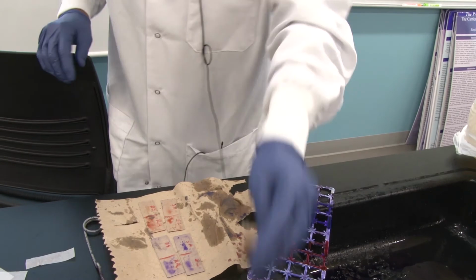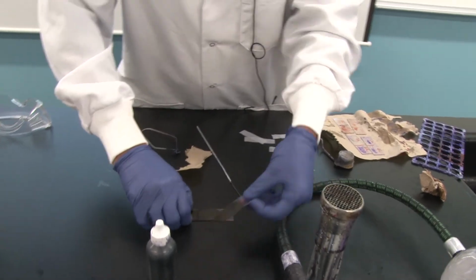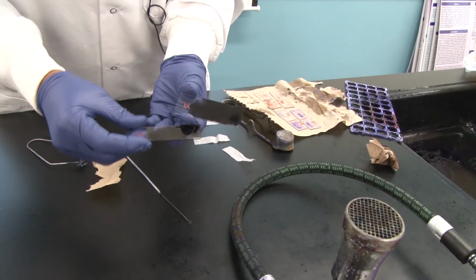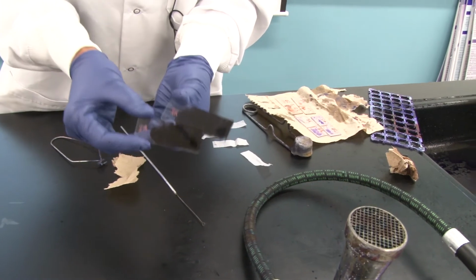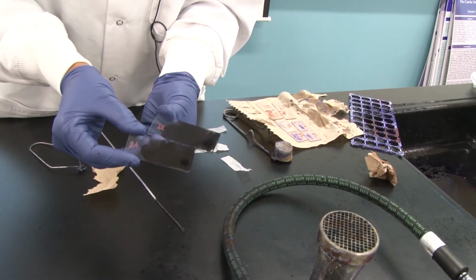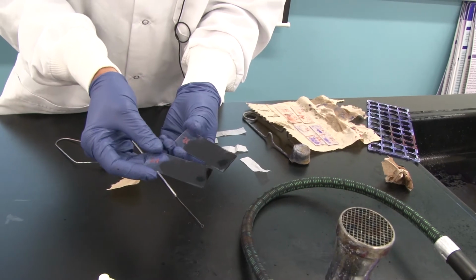Okay, so let's go back to our simple negative smears. Here is Rhodospirillum rubrum. Here is Staphylococcus aureus. They are now air dried. The thing about a simple negative stain is you do not need to heat fix it. In fact, heat fixing will ruin it. So we are simply allowing these to air dry, and then they are ready to go on the microscope.